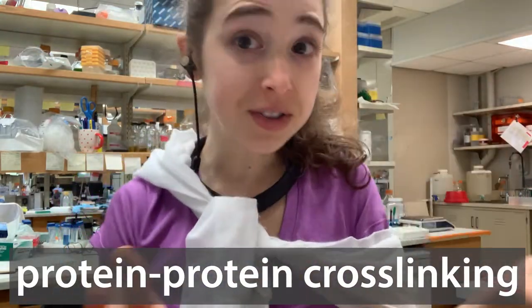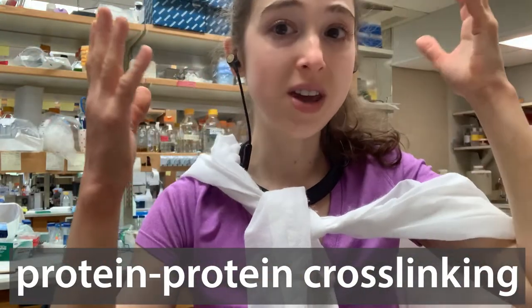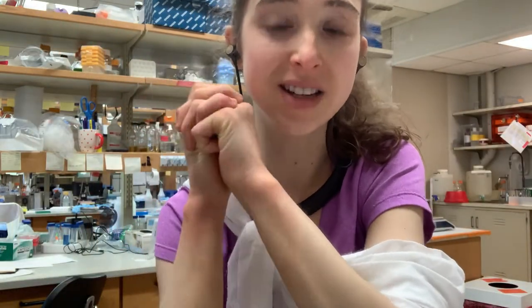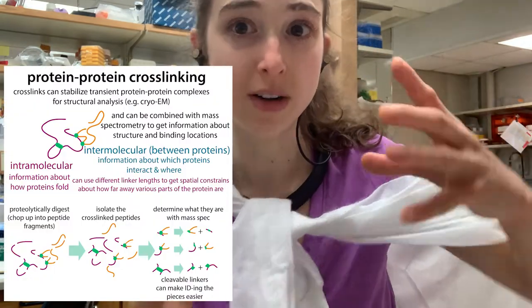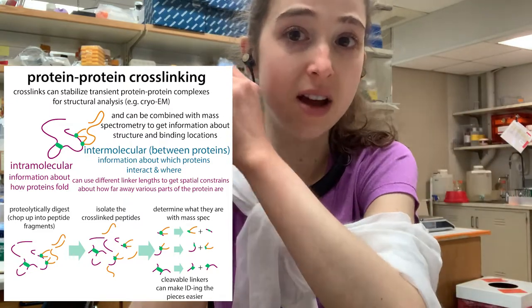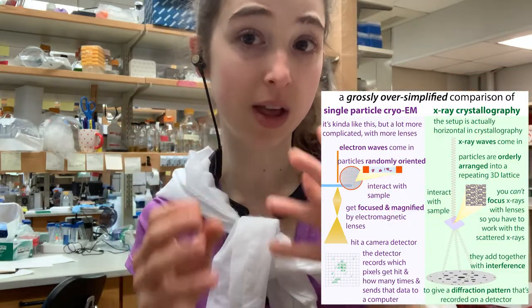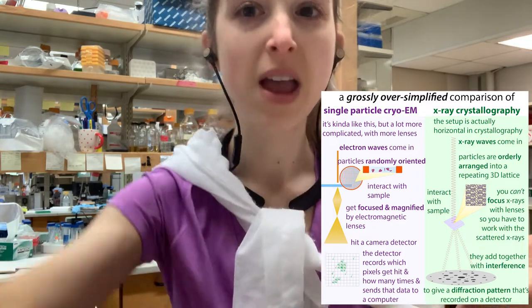Cross-linking! Protein-protein cross-linking is a way that you can capture proteins as they're interacting, and this gives you information about where they're interacting and what they're interacting with, as well as helping stabilize the interacting partners in order to use structural biology techniques like cryo-electron microscopy or crystallography to study the complex.